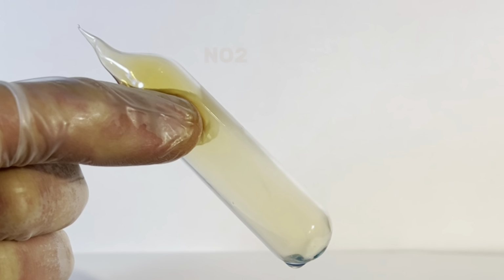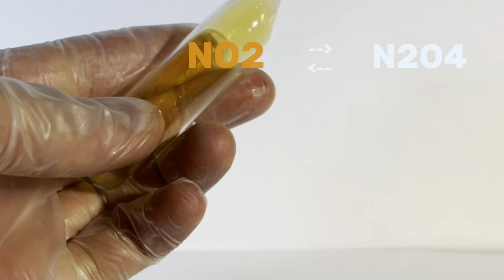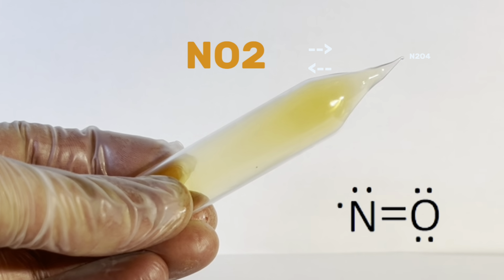You can see that when I take it out of the bath and warm it up, we get that lovely red-orange color back. Pay no mind to the beautiful blue droplet at the bottom of my ampule, by the way. This is definitely totally pure nitrogen dioxide with no contamination.